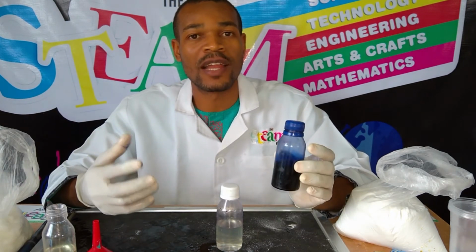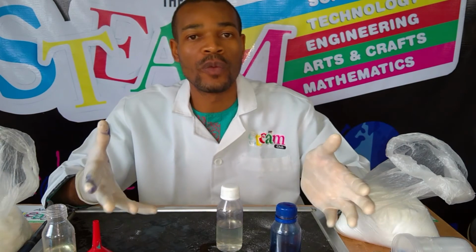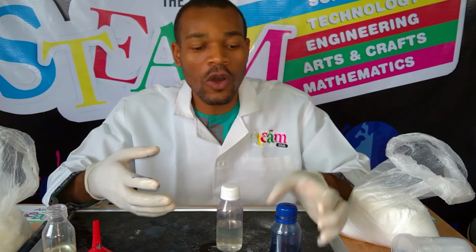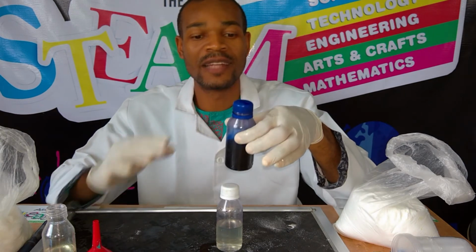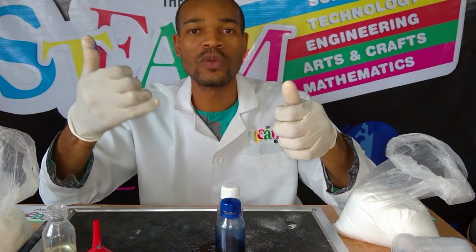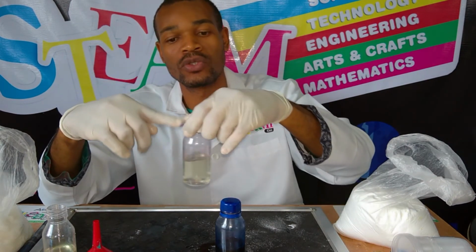But this oxygen can actually be taken off of it. And that is exactly what our glucose did. When we mixed the glucose with the potassium hydroxide together, the glucose takes off the oxygen from this methylene blue, and it reduces the methylene blue from blue to colorless. And when we leave it, everything settles down. The methylene blue takes back up oxygen from the space in the bottle.